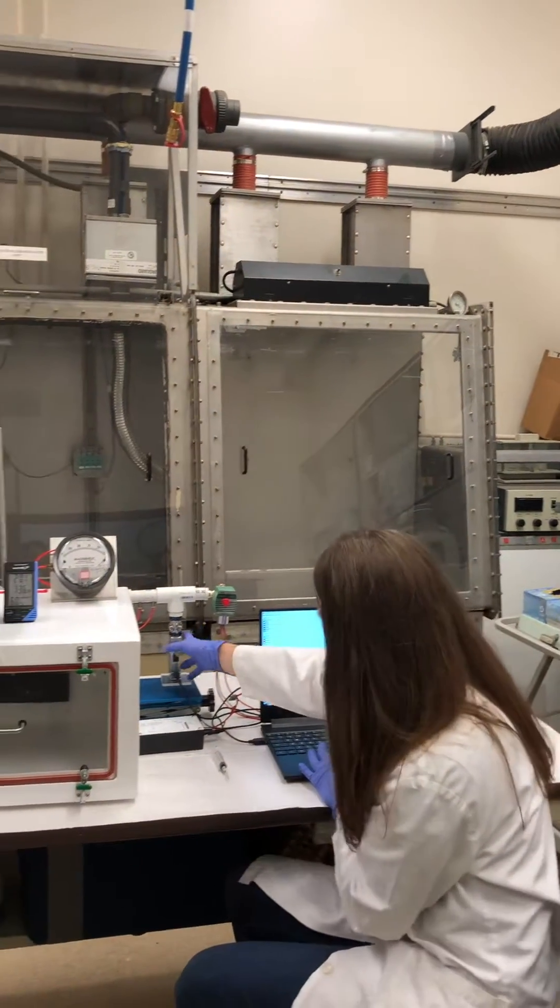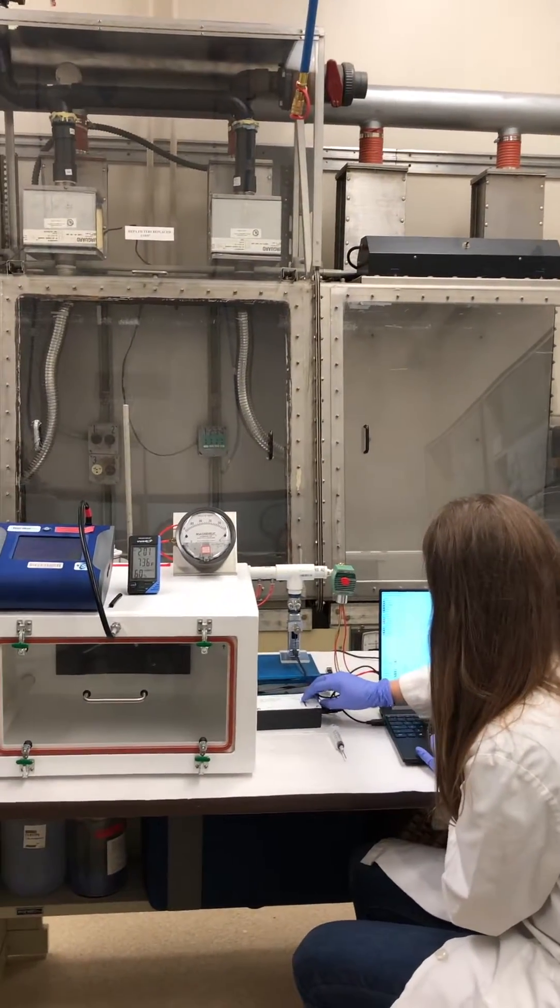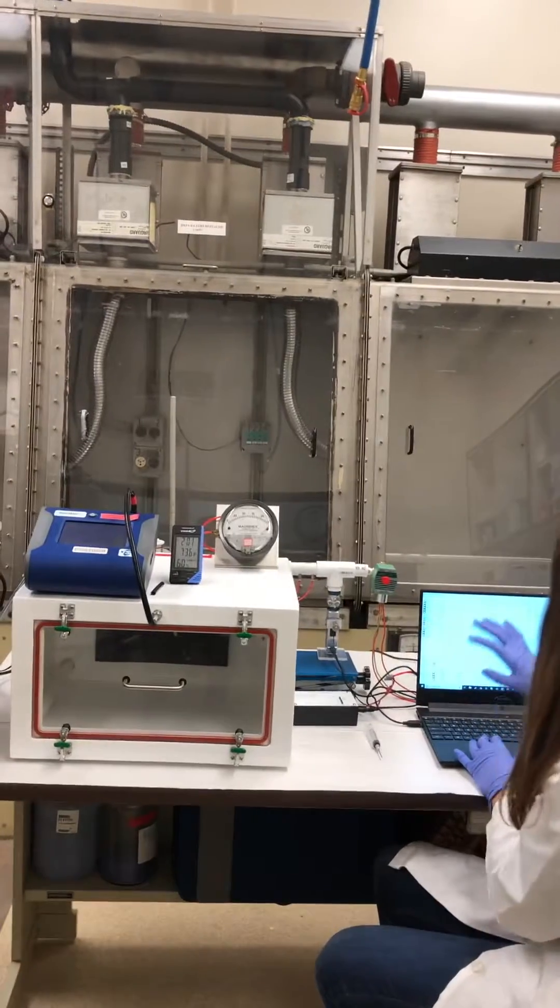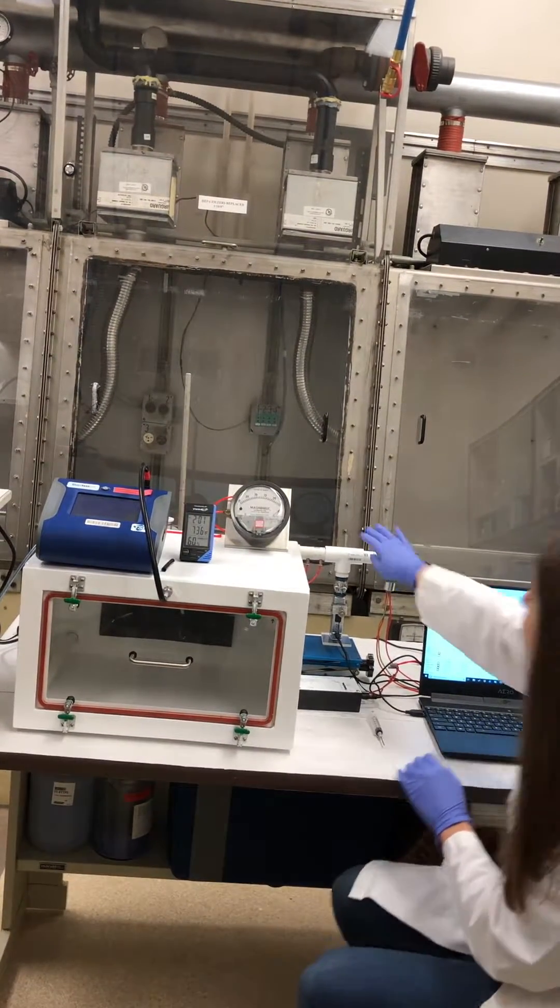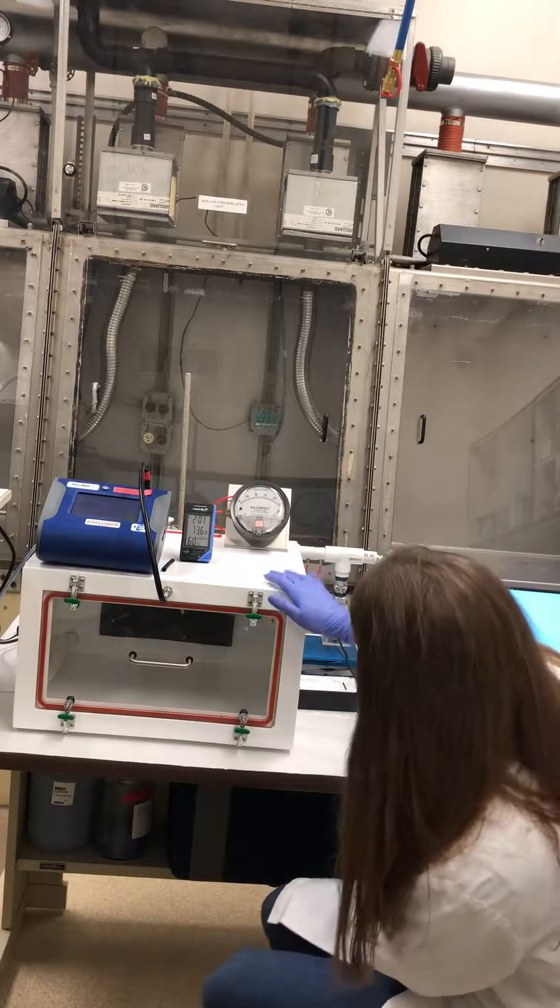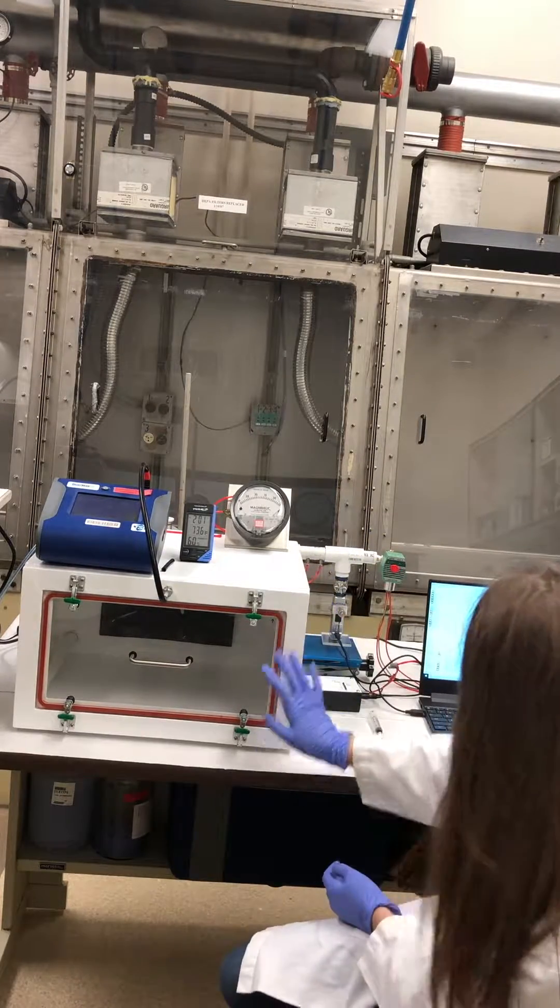So our device is right here. I will switch this on and it will do a puff every 30 seconds. And so that will go directly into the chamber here, and you should be able to see it.